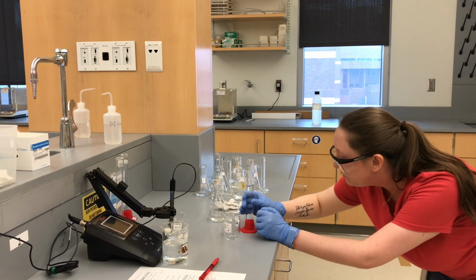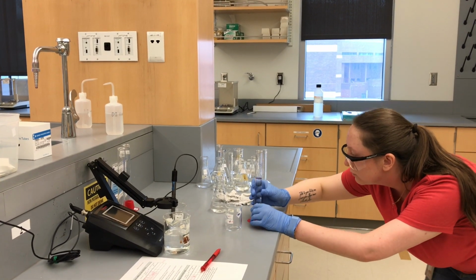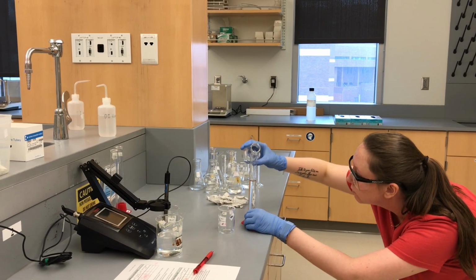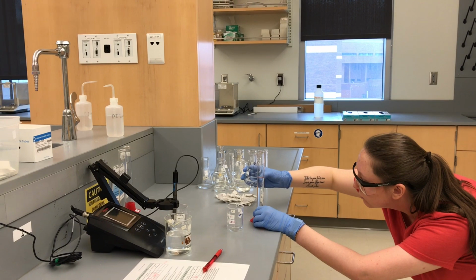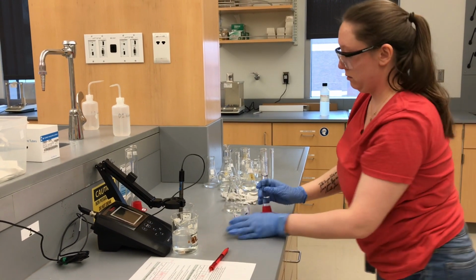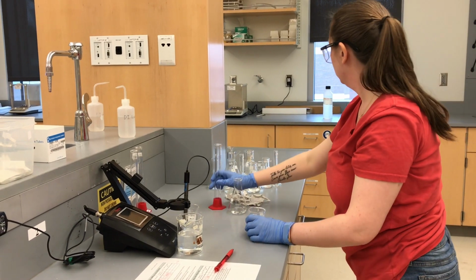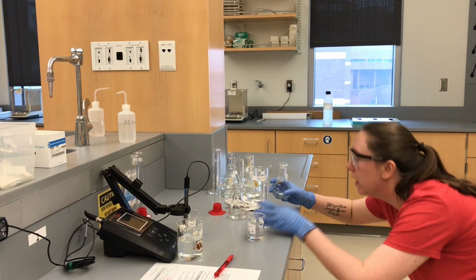All right. All right, 40 mils of G. And we need our 2 mils of NaOH.